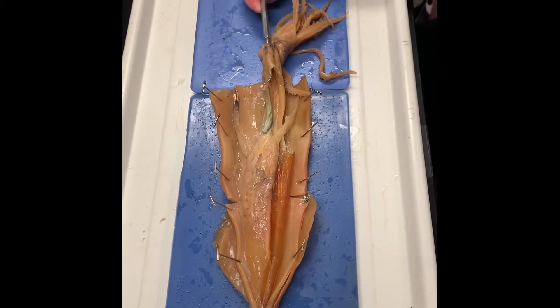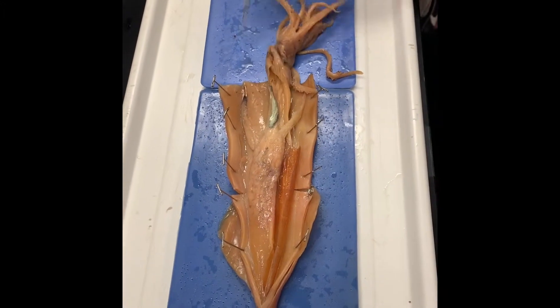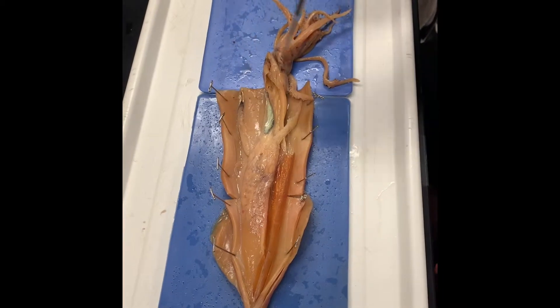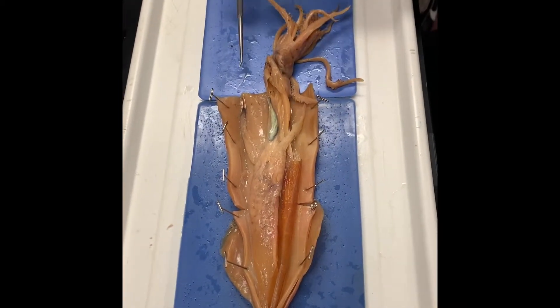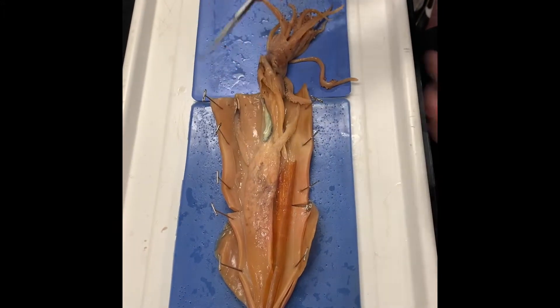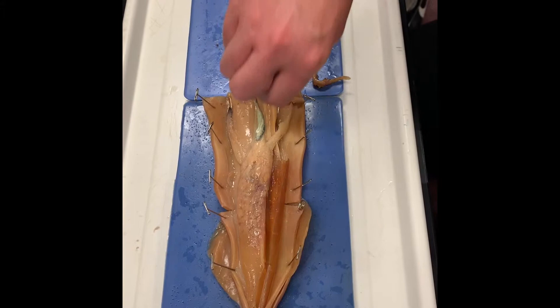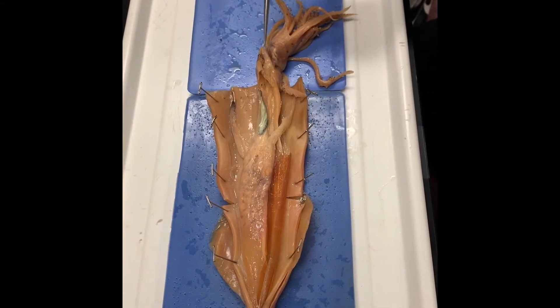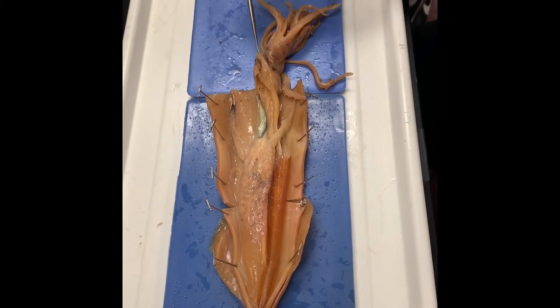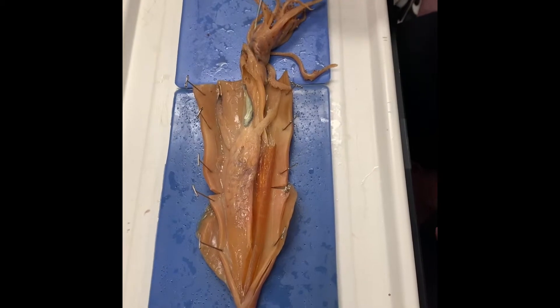Remember how it works? We cut open the mantle. The collar is just the base of the mantle — normally it forms a ring around the mantle. Water enters up into the mantle cavity and then it pinches off at its collar, so the only way water can get out is by shooting through this funnel. That then projects the squid in whichever direction it's aimed — if the funnel points that way, the squid will go this way after it shoots its water out.